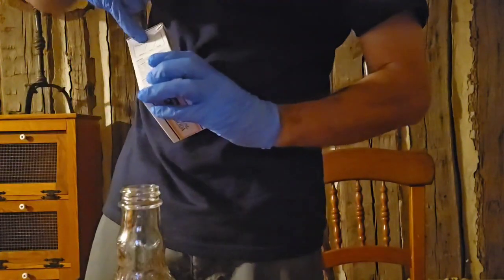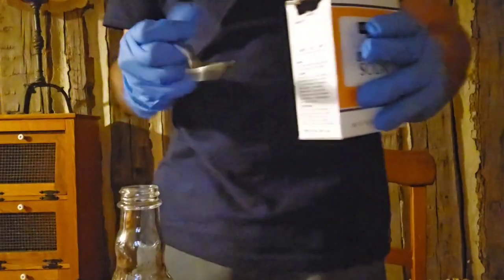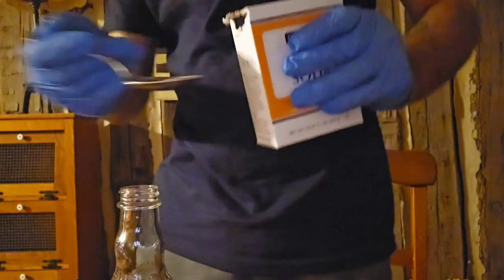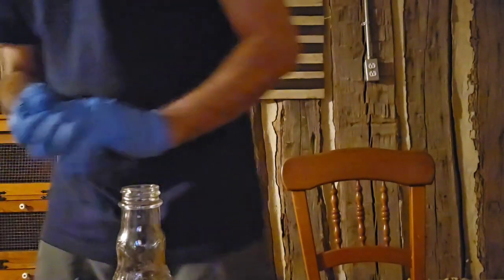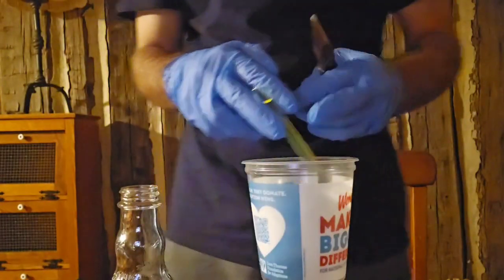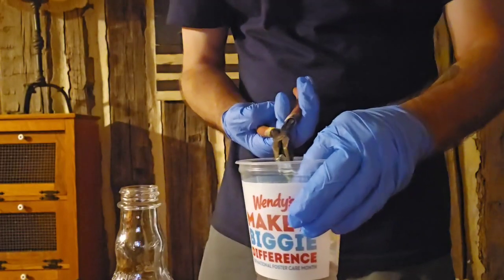Now, I'm going to put a little bit of baking soda on a spoon, okay? That's the way I choose to do it. You can do it however you want, but you don't need a whole bunch. See, just about like that. About that much should be good. Just enough. Now, I'm not putting that in there yet. I'll do that last. What I am going to do is take little needle nose pliers, right? We're going to break the glass in this cup that I got, because I'm going to throw this cup away anyways. Try to not make a mess, which is why you need these safety glasses and everything, okay?